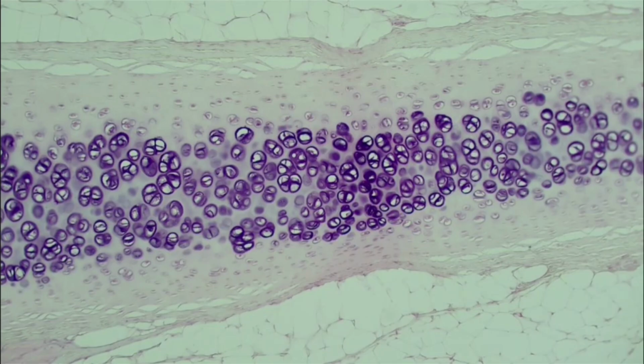Coming up next, we have our hyaline cartilage, and if you'll notice, around the edges, we have that adipose tissue. That's another identifying tool sometimes, is being able to know what kind of tissue surrounds the thing you're looking at. But when we're looking at these cartilages, the main things, we're looking at this strip right here, right? We're not taking too much care to this around here. I just thought I'd point it out, but we're mostly just looking at this strip right here. And a tip for identifying hyaline cartilage is going to be that it's very glassy looking. It's very smooth. Very, very smooth. We have all of these little holes right here, but we're really just looking at the smoothness.